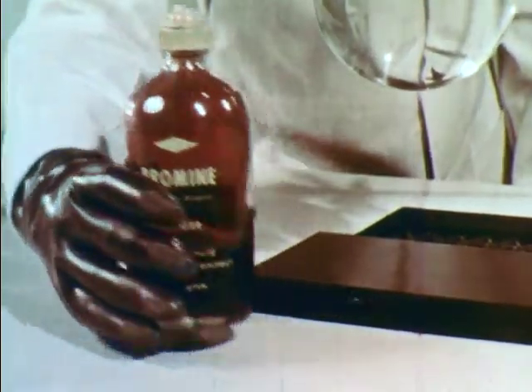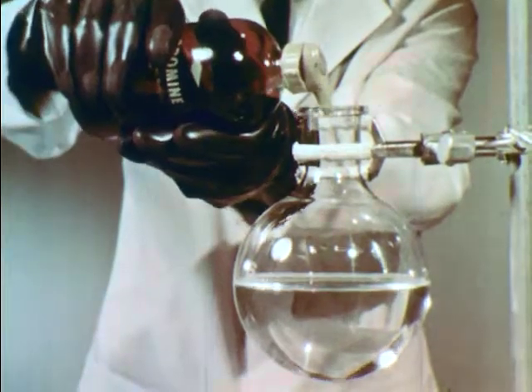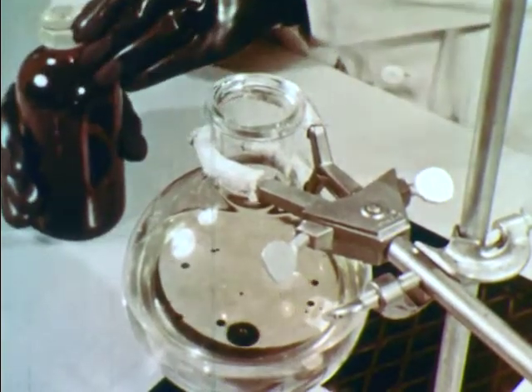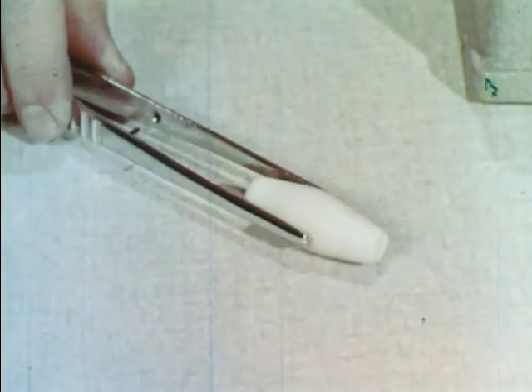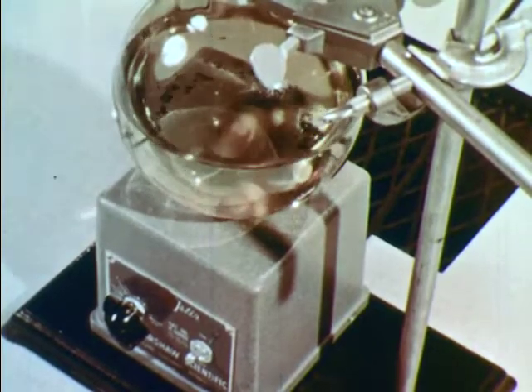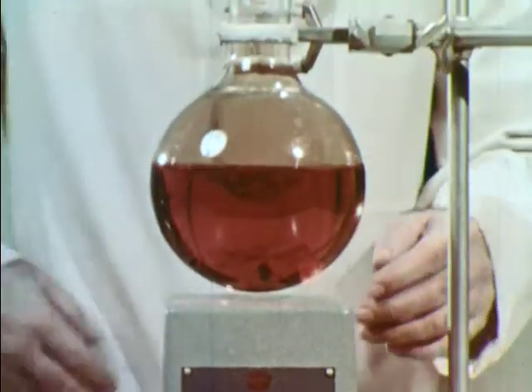But what about the solubility of bromine itself? When bromine is added to water, it settles to the bottom, indicating it is more dense than the water. Vigorous and prolonged stirring with a magnetic stirrer gives us a saturated solution. The brown color is characteristic of aqueous bromine solutions. However, some drops of bromine remain undissolved, indicating that elemental bromine is not highly soluble in water.